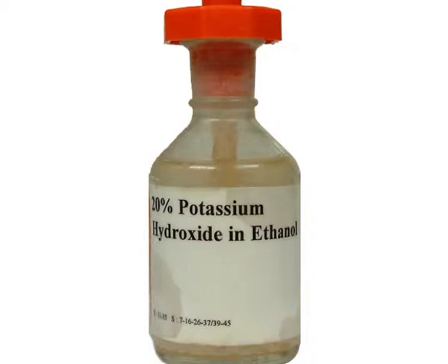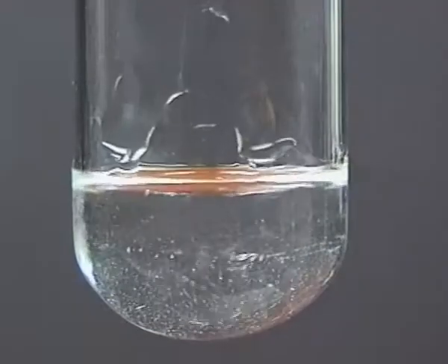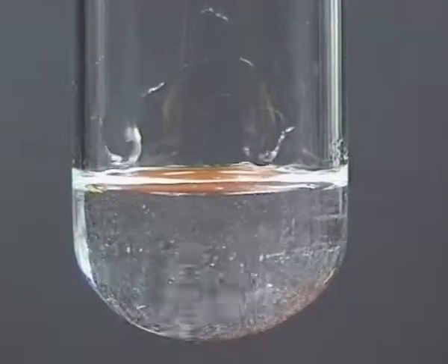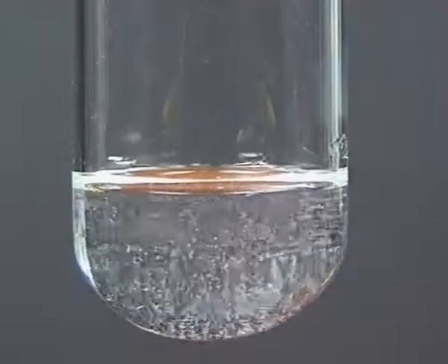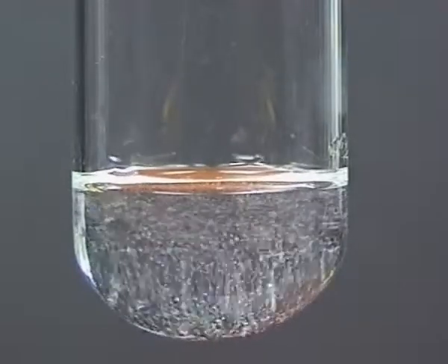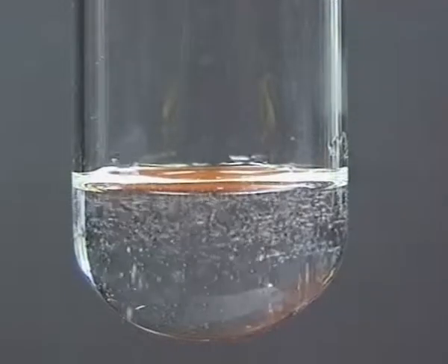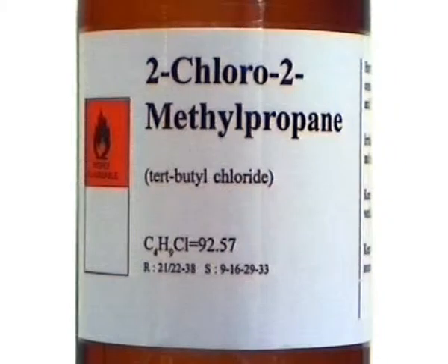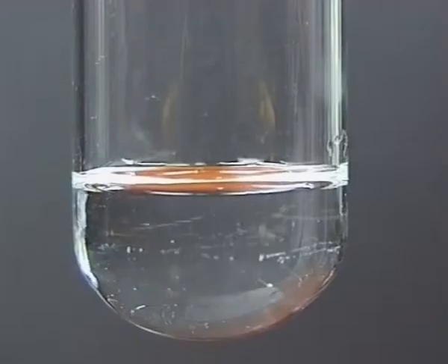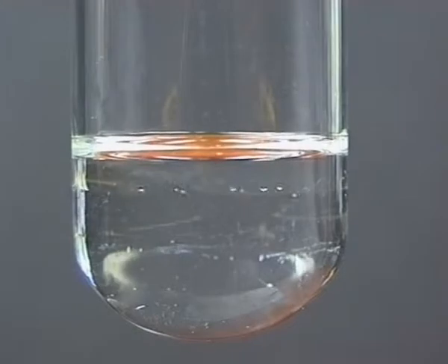Some 20% potassium hydroxide in ethanol was diluted with an equal volume of distilled water and the two liquids mixed. Some 2-chloro-2-methyl propane was added and the mixture was shaken for around a minute.